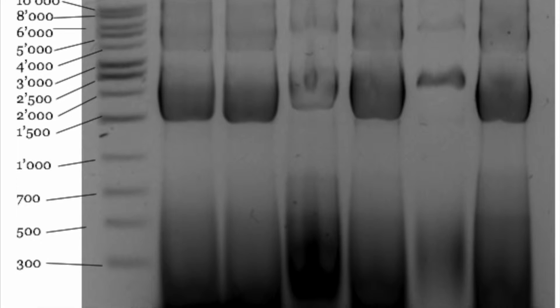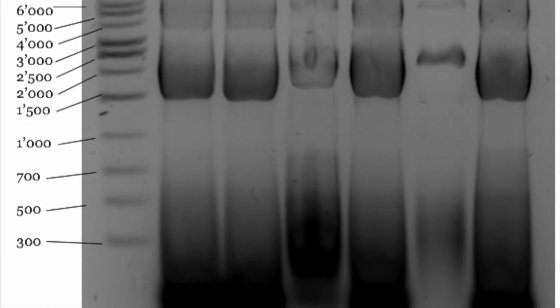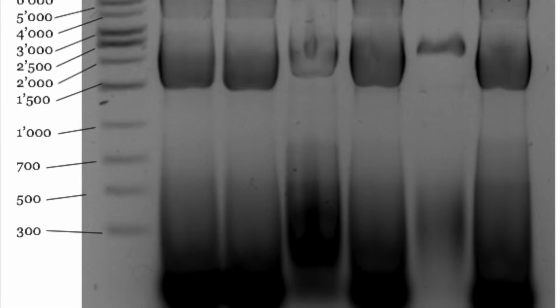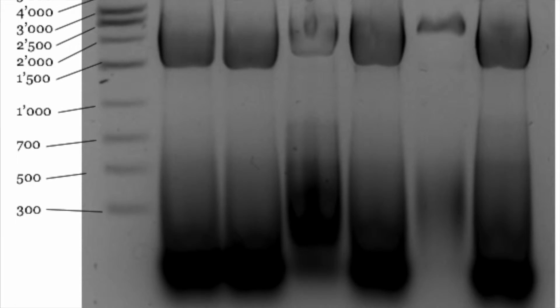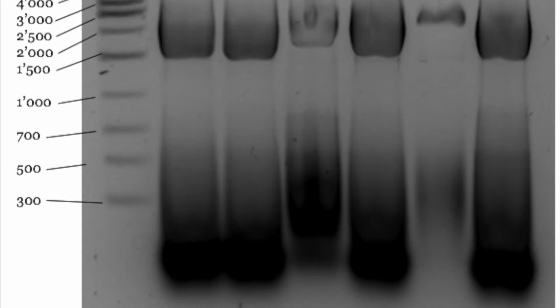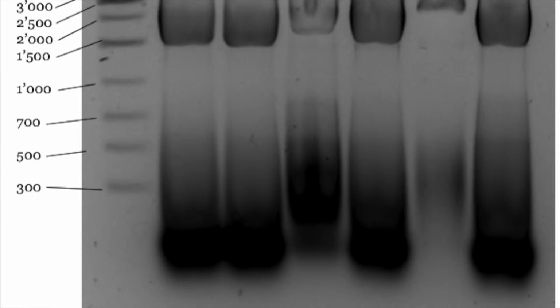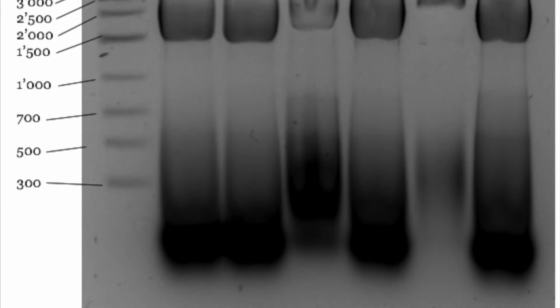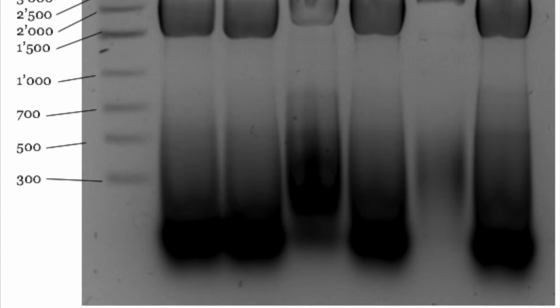It is very important to control the time so that only the plasmidic DNA can exit the cell and that the lysis creates just the pores necessary for the plasmidic DNA to exit. A good integrity and purity is required, as there are no degradation signs in the gel.